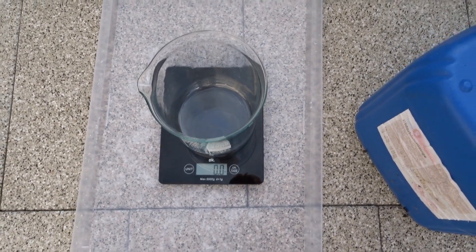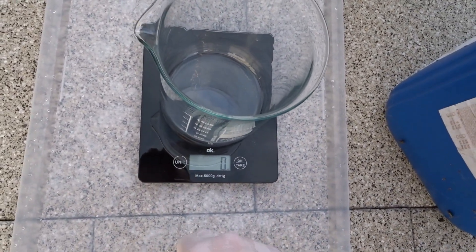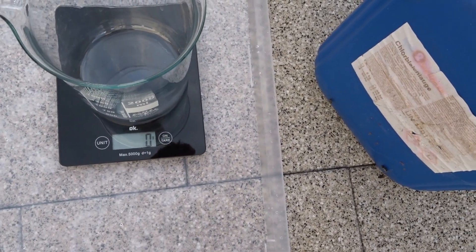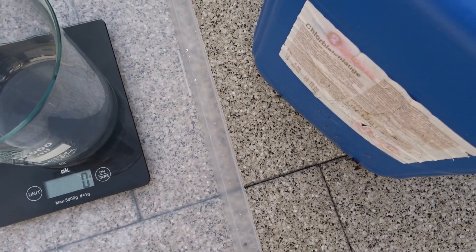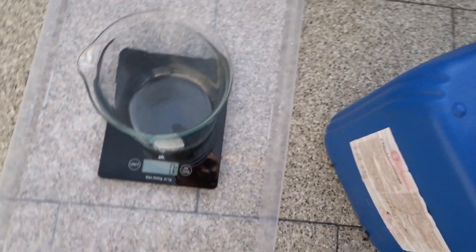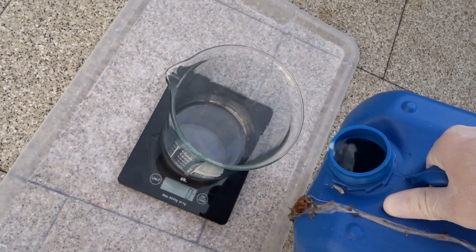So I'm going to refill this now. This is on ounces. No, we are not Americans. Oh, the stuff is literally like poison in the can. The stuff stinks. I don't like working with it. Well, I guess I have to.